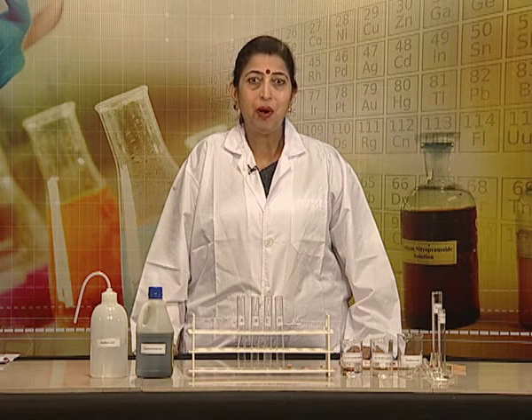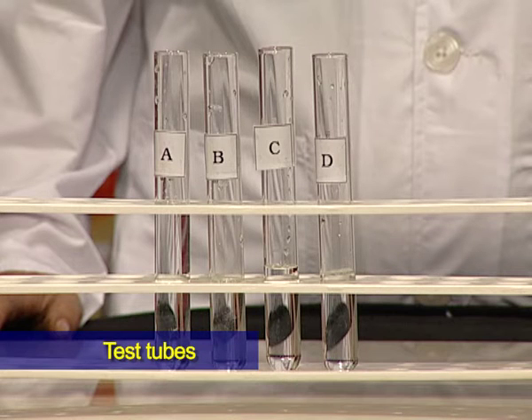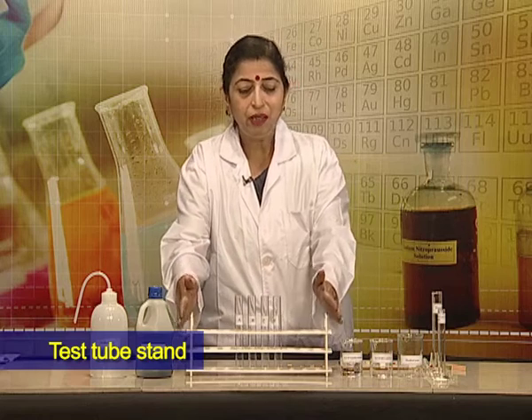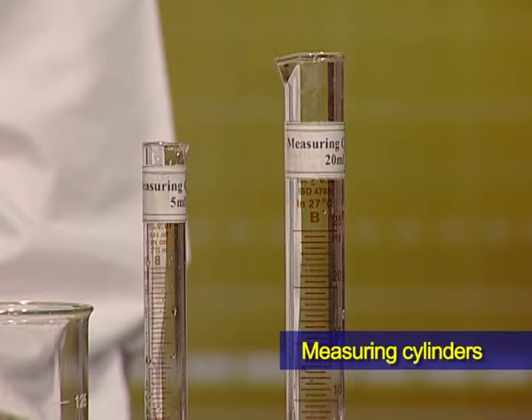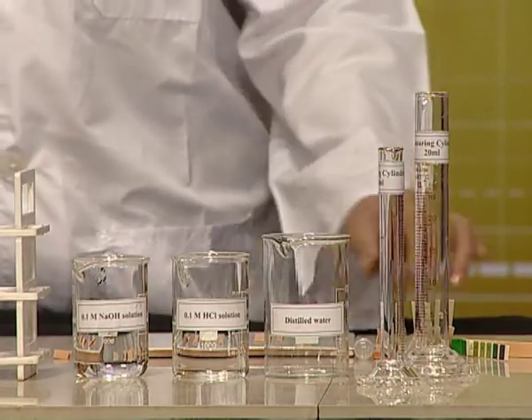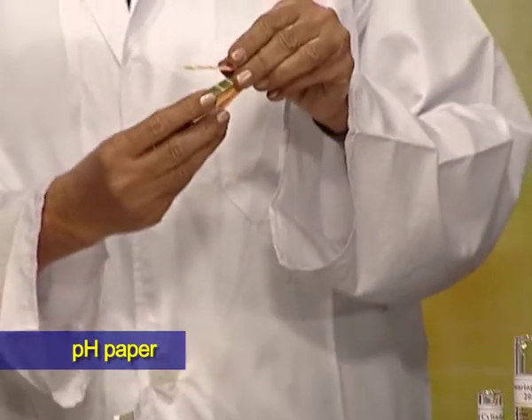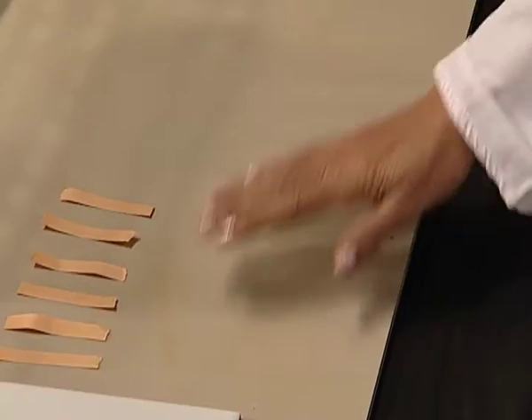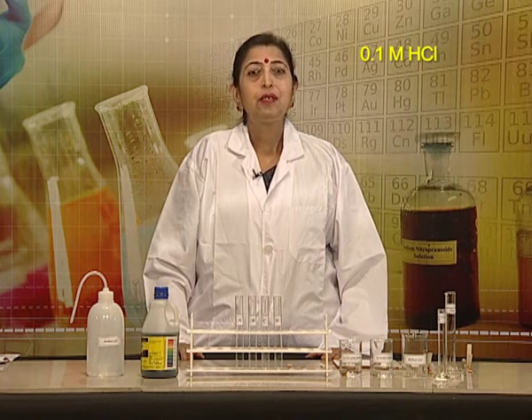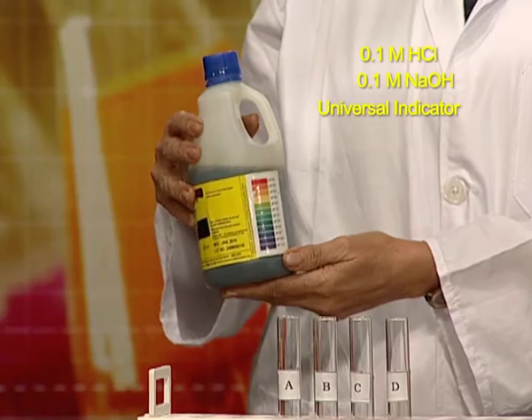The apparatus and chemicals required for this experiment are as follows. These are four test tubes labeled A, B, C, and D. We need a test tube stand, measuring cylinders, 100 ml beakers and 50 ml beakers. Besides this, we need a glass rod, droppers, pH paper, and a white tile. The chemicals required are 0.1 molar hydrochloric acid solution, 0.1 molar sodium hydroxide solution, and universal indicator solution.